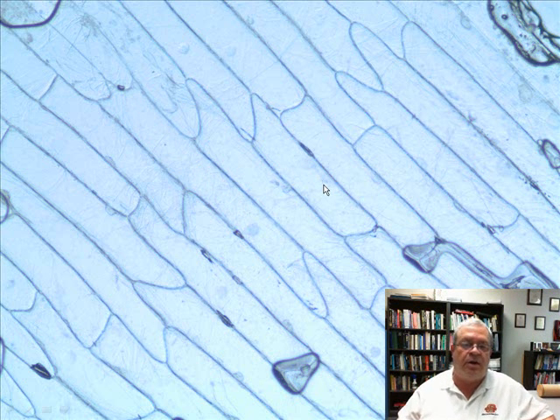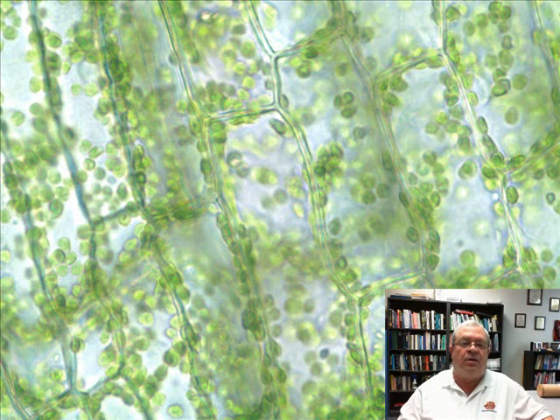There you have it. Let's look at another type of cell, another type of plant. Looks quite a bit different. But what's the name of this species? What name did I give you? It's called Elodea. Yes, Elodea. E-L-O-D-E-A. Elodea. Has all the same things as onion cells.